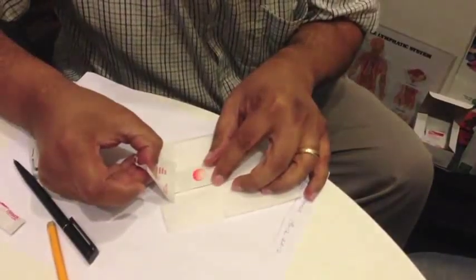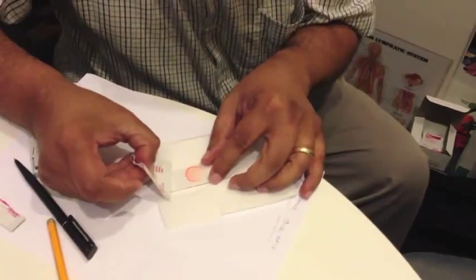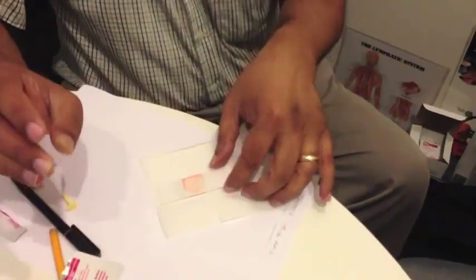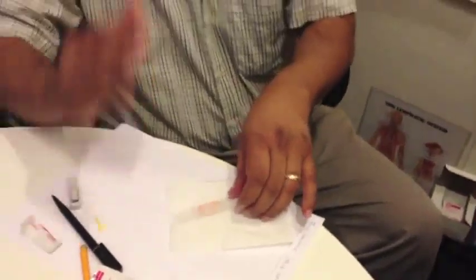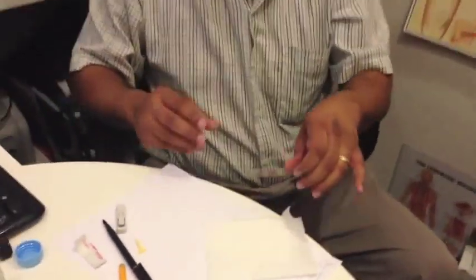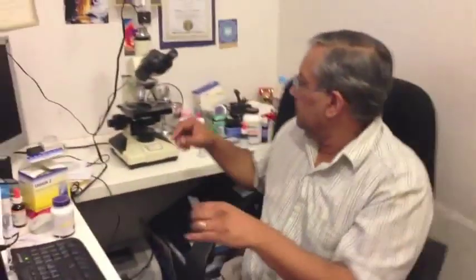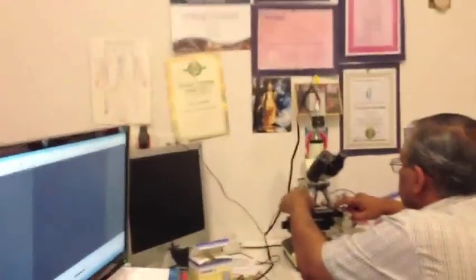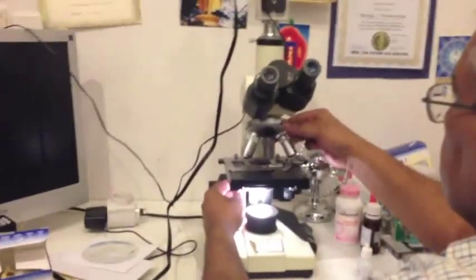So that's important. It should spread nicely like that, because you could damage the blood otherwise. That goes under the microscope.